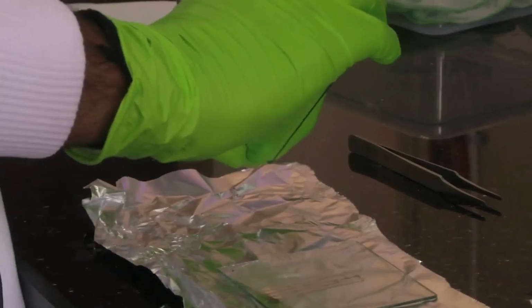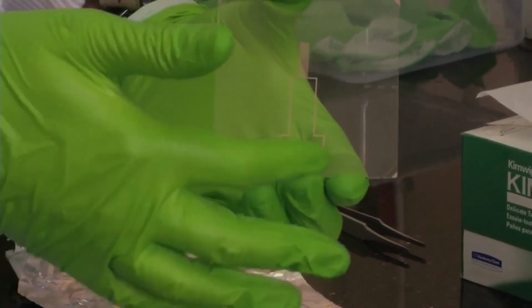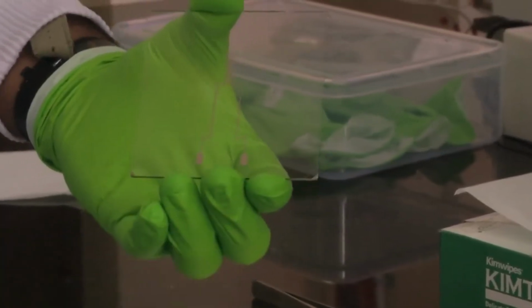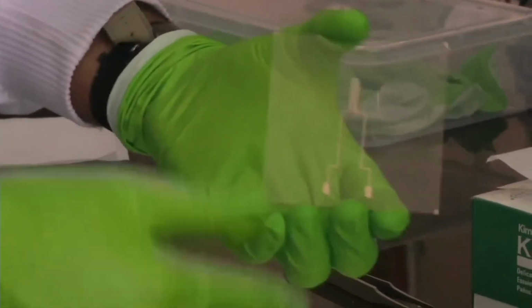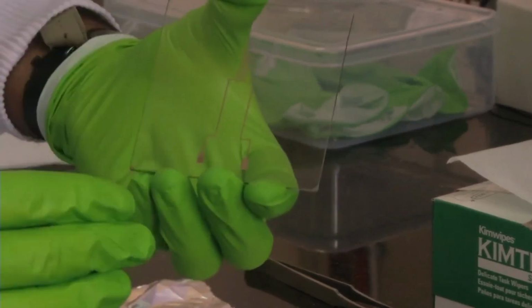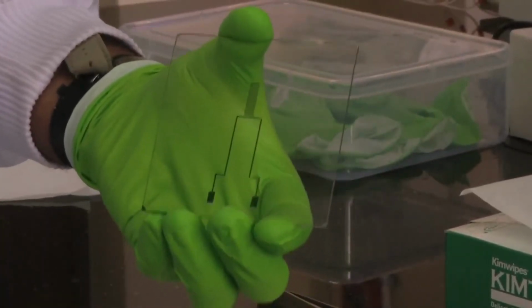Next we have another glass slide. This is a heater that is patterned using nickel. With similar methods, you first deposit nickel, and then you pattern it using photolithography, and then again you can bond microfluidic channels on top of these nickel electrodes. So this is not an electrode, this is a heater. It is still an electrode, but the construction is different. Its purpose is to just heat to a particular temperature, so that if you have biological experiments, you can maintain your samples at a particular temperature.